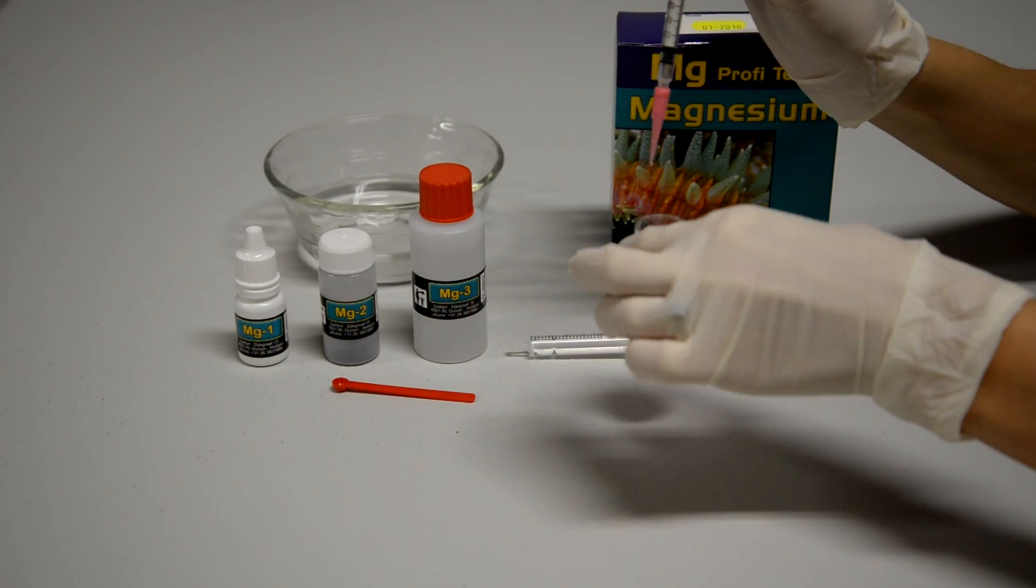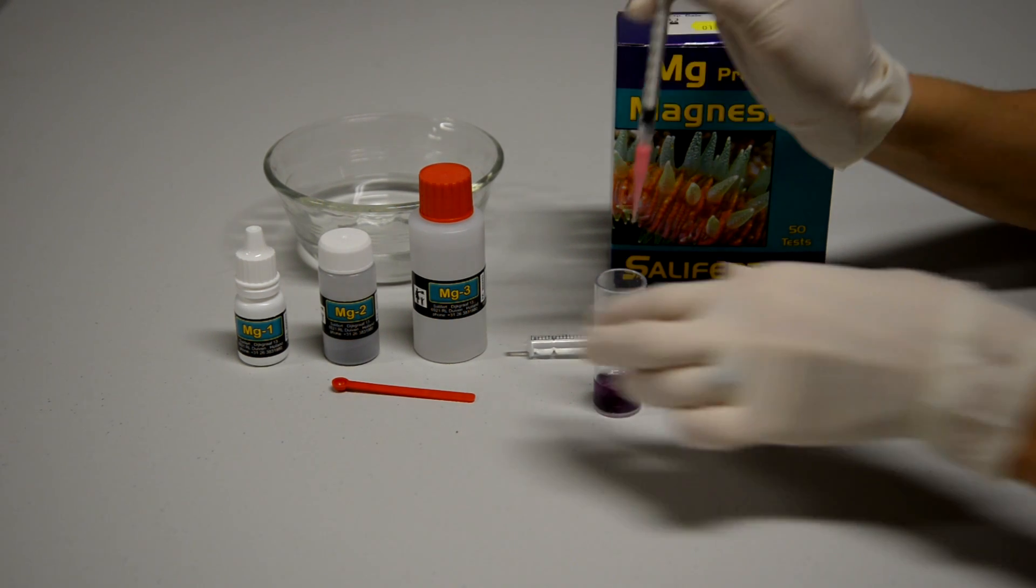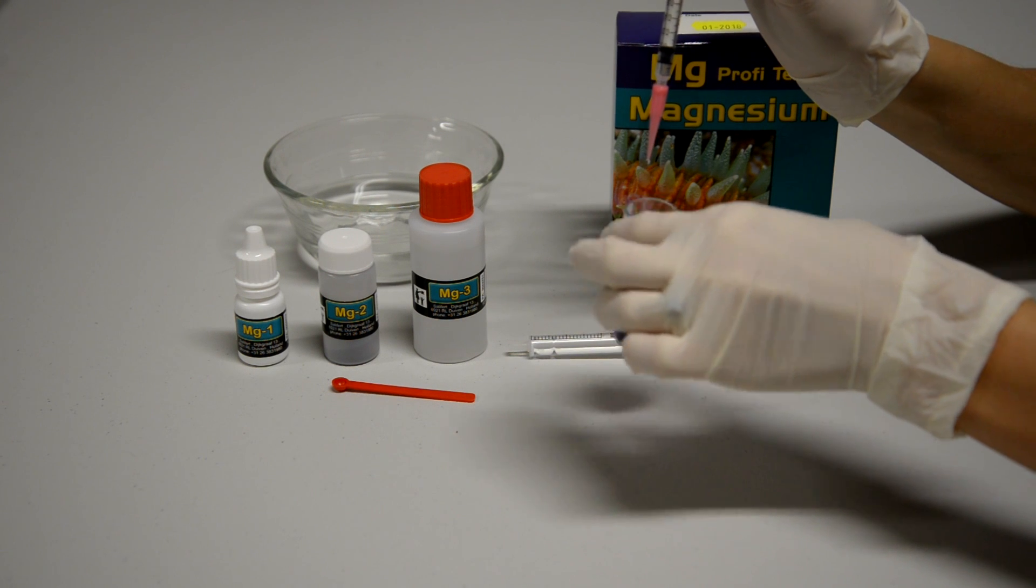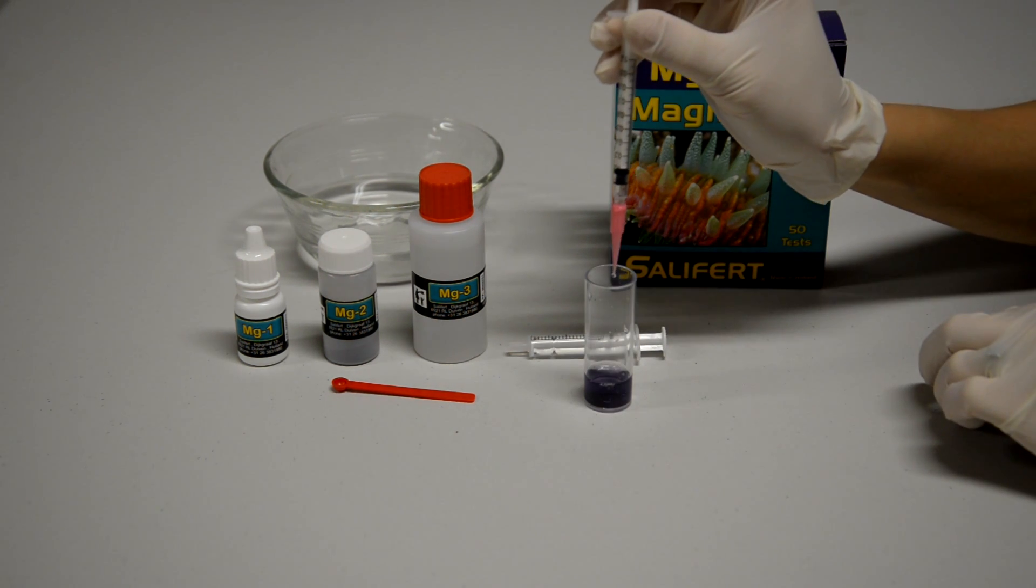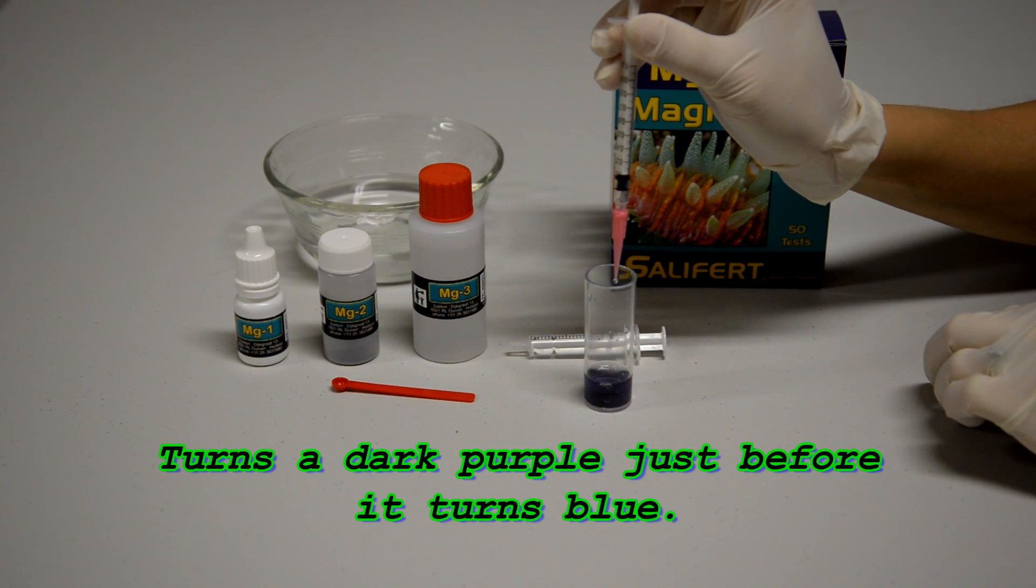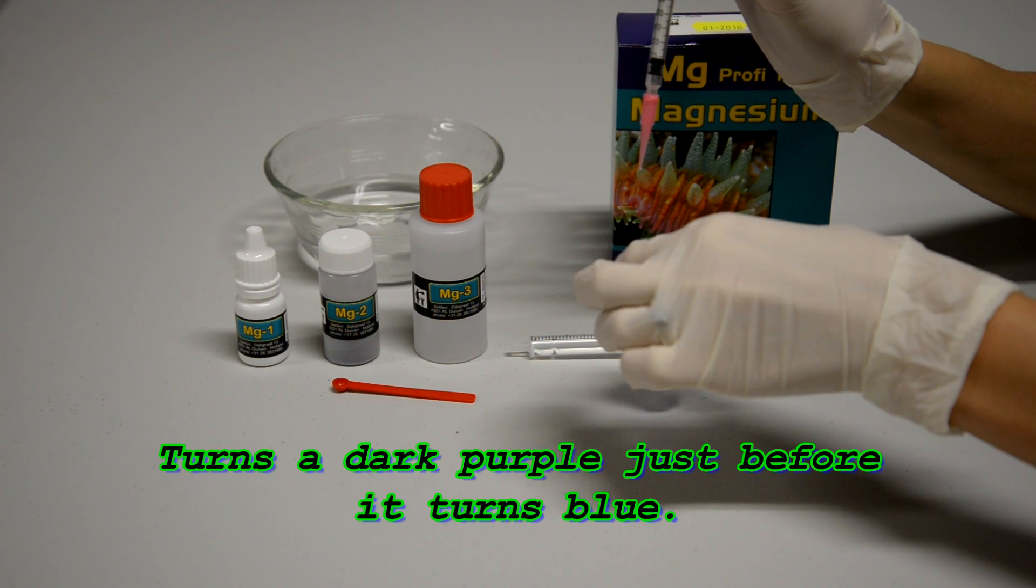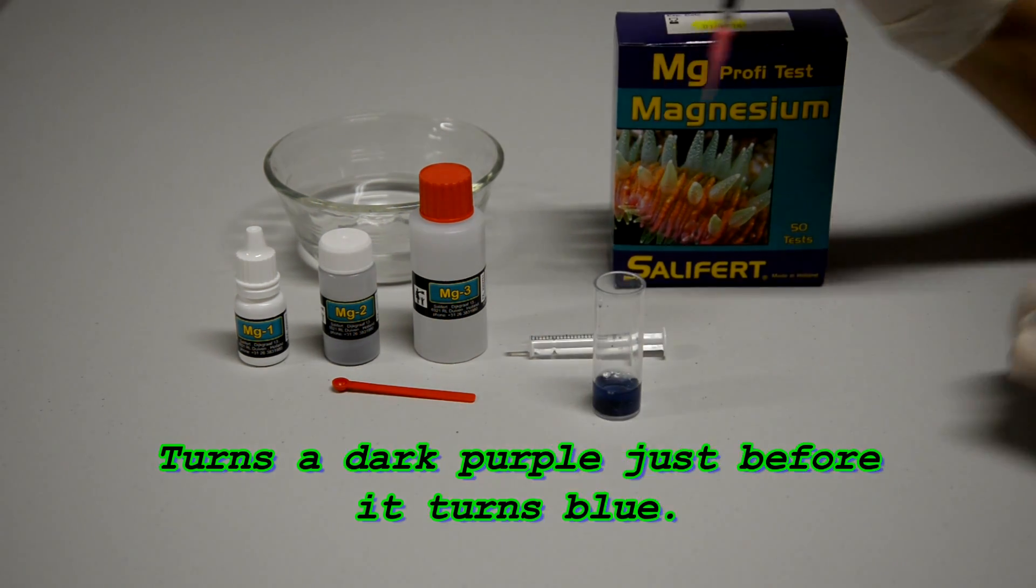You're going to have to only add a couple more drops and then it will turn a very nice shade of blue. That's when you stop. You can see it's getting dark here. It's probably going to be our last drop. Shake it up. And there you go. Now it's blue.